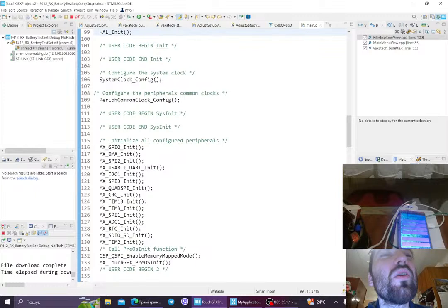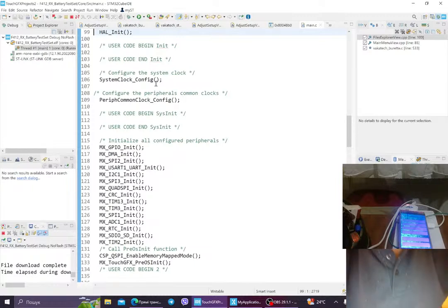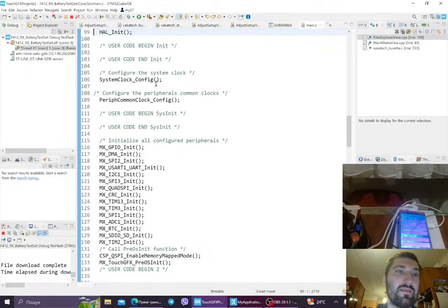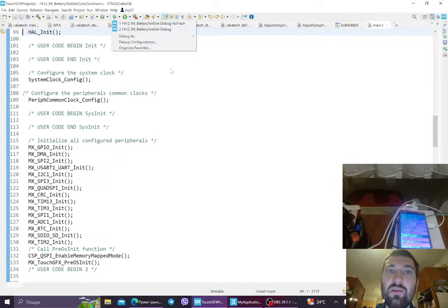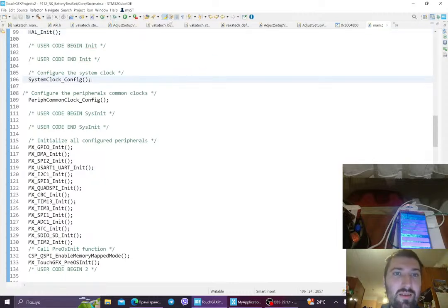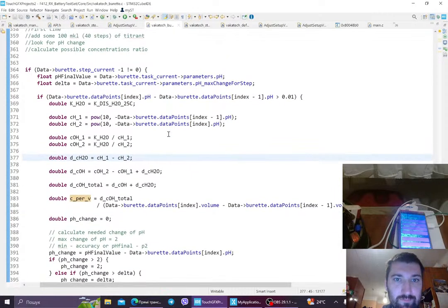So anyway, let's go here. I'll go into adjust. Yeah, here. See? It works just as intended. So we've created something like radio buttons. And don't be afraid that there is no text. This is just because we did a no flash download. I have several presets, with no external flash for the imagery and with the flash, but it takes a lot of time. So let's go to burette.